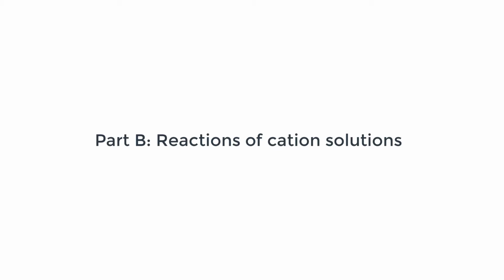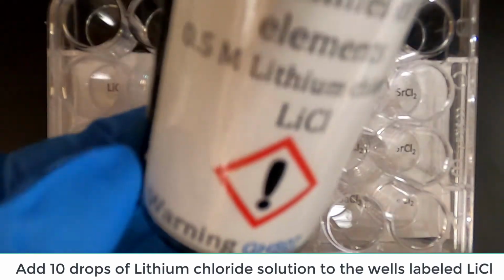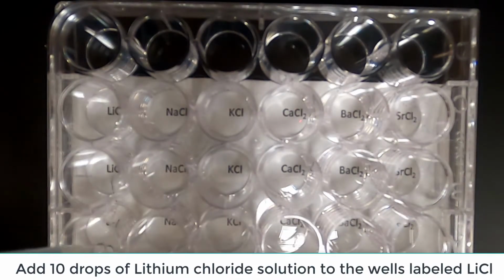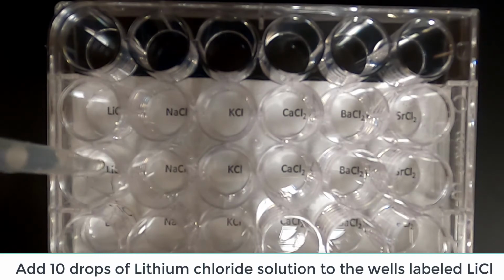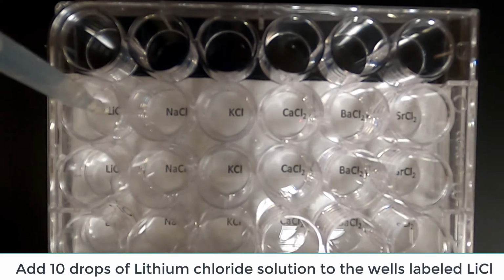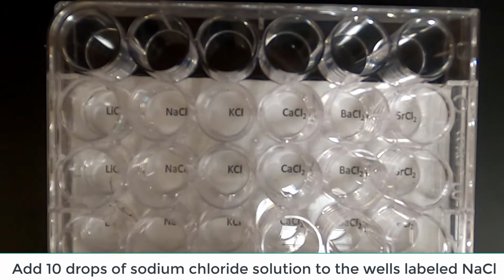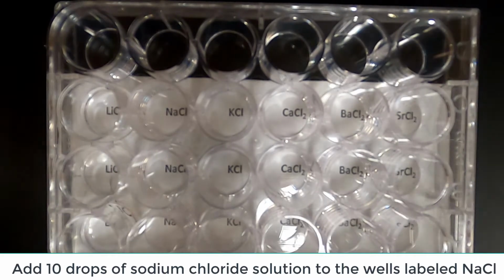Part B. Reactions of cation solutions. Obtain a well plate. Into each of the 3 wells labeled lithium chloride, add 10 drops of lithium chloride solution. Into each of the 3 wells labeled sodium chloride, add 10 drops of sodium chloride solution.